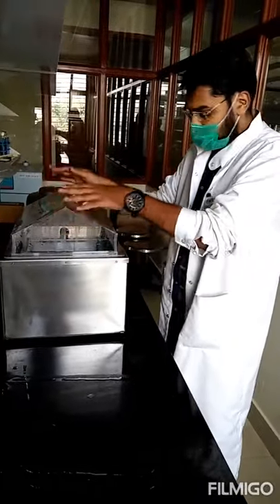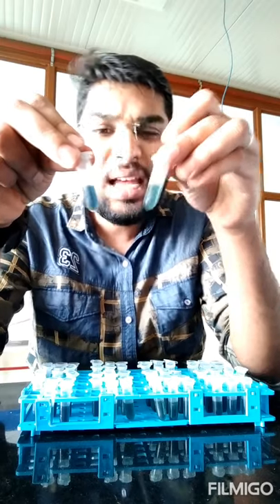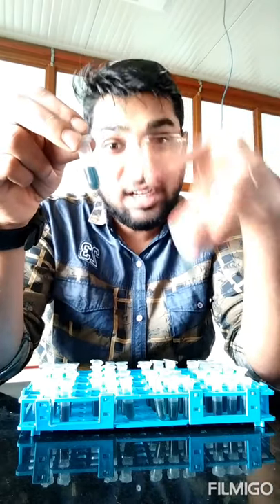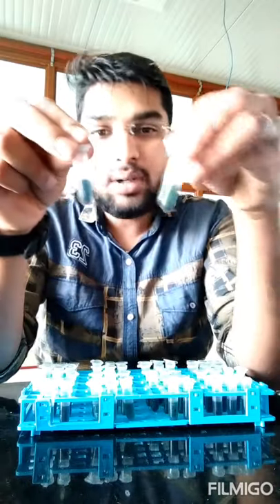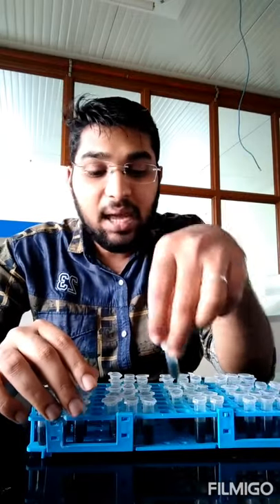After one and a half hours of incubation at 90–95°C, I have cooled the samples to room temperature and given a quick spin on the vortex. You can see a beautiful blue color has developed. The root sample is dark blue, stem is lighter — indicating roots have more antioxidant molecules, reducing more phosphomolybdenum. The seed extract is the darkest color, then root, then leaf, and stem is the lightest — suggesting seeds have the highest antioxidant activity in this medicinal plant.